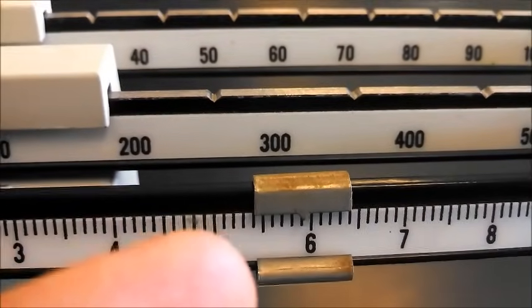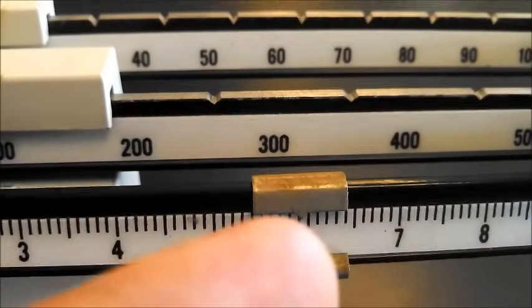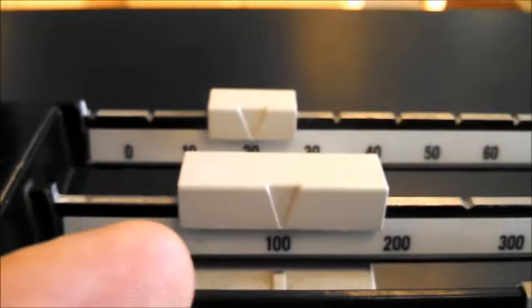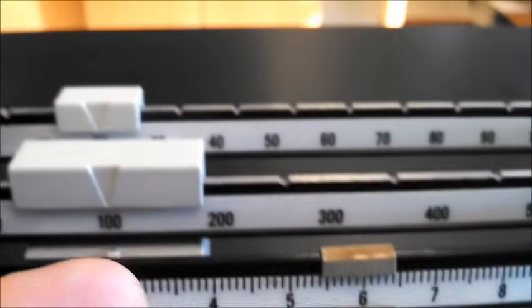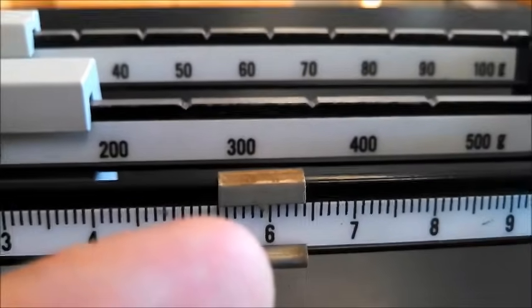How many lines over is it, 1, 2, 3, 4, 5, 6, 7, 8, 9. So, 125.9.